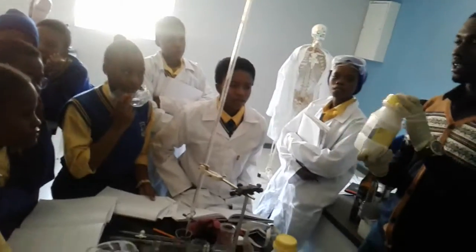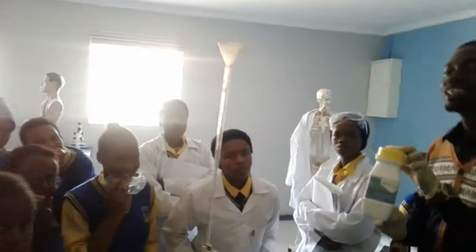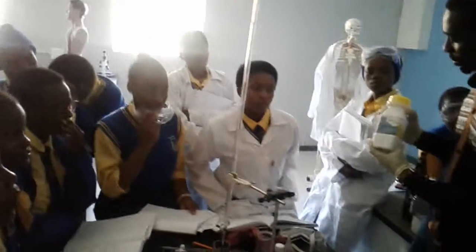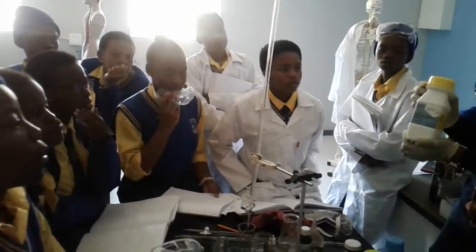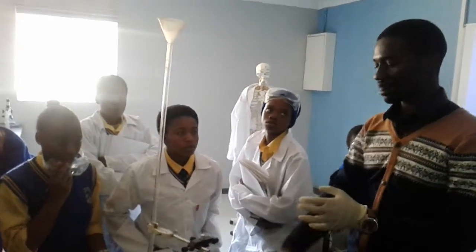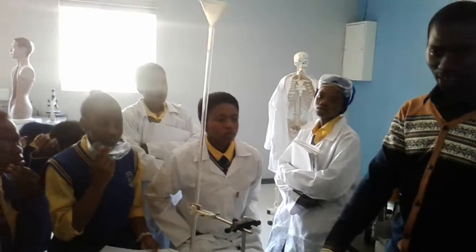Talk to me. Is this a strong or weak base? Strong base. Okay. Know yourself. Guys, let's be quiet. This one, is it a strong or weak base? Sodium carbonate. It's a weak base. Sodium carbonate. Guys, carbonate, it produces what? If I add an acid to a carbonate? Salt, water, and carbon dioxide.